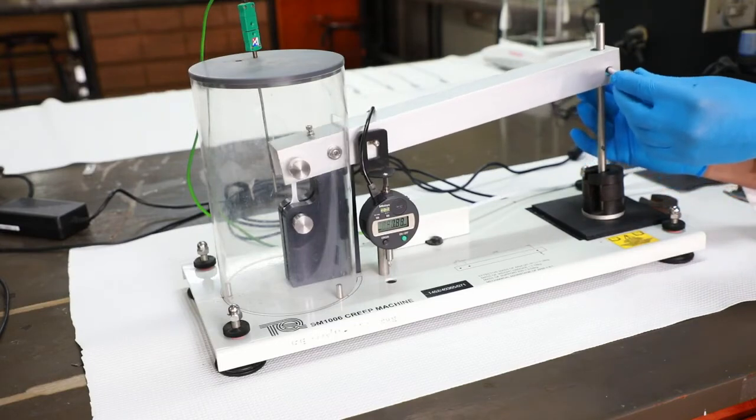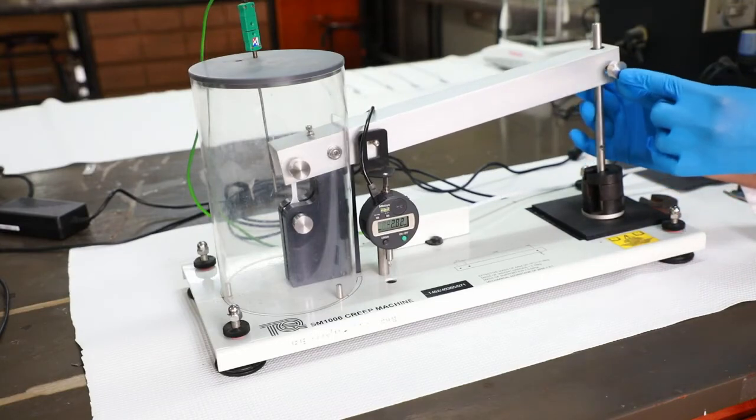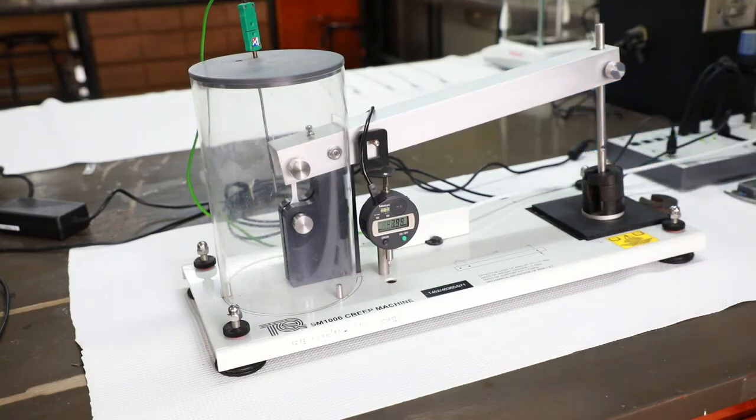Stop recording after 10 minutes and remove the sample from the apparatus.